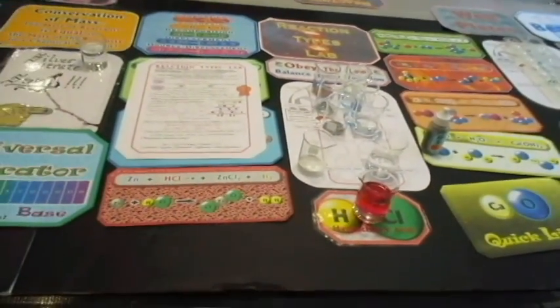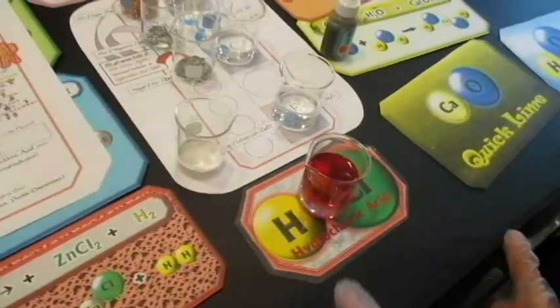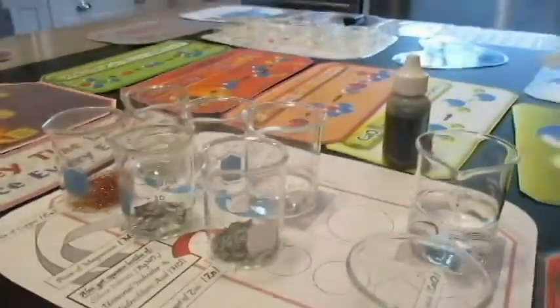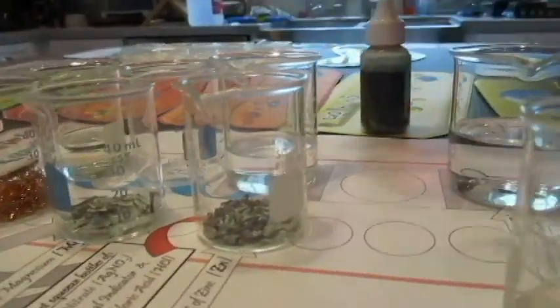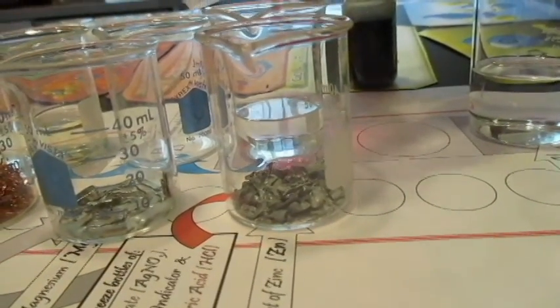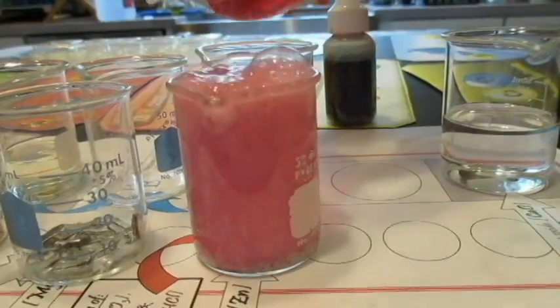Yeah. Okay, so we are going to be reacting that with the zinc. So go ahead and pour it in, and I want to get a good shot of the reaction. And once it gets going, Giovanna's going to get the temperature. Doing this one? Yeah, into the zinc. Just pour most of it in. We're doing a big scale reaction. Okay, that's good. That's enough.